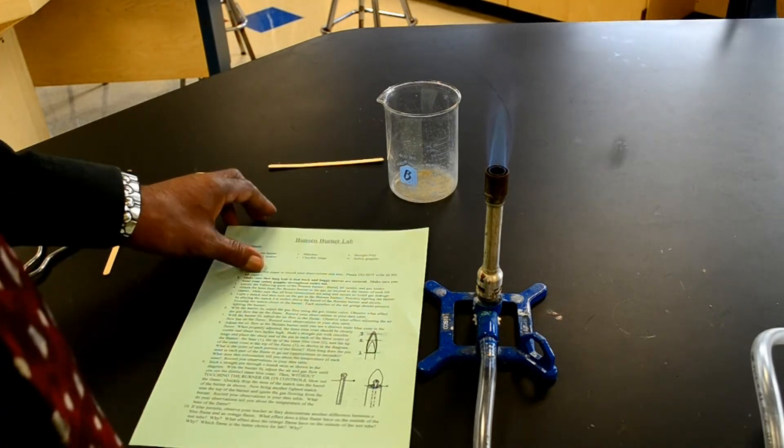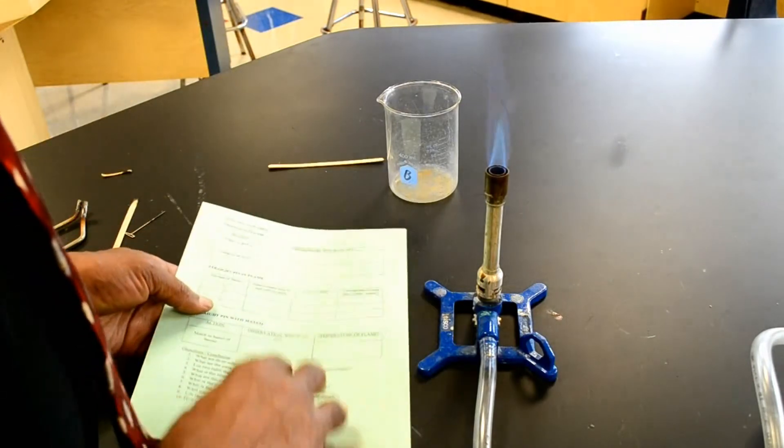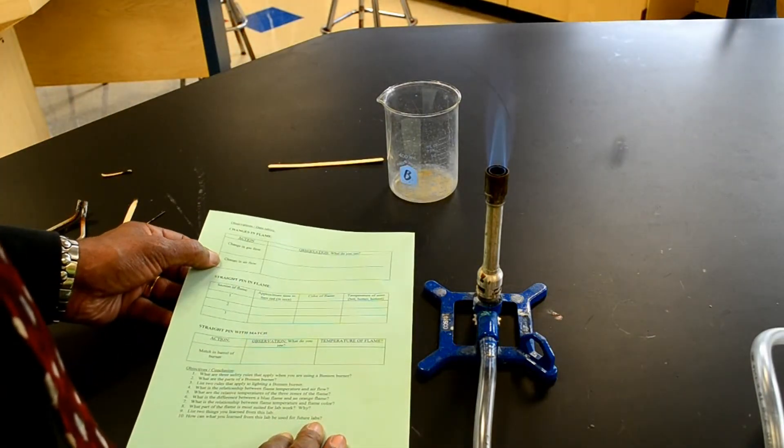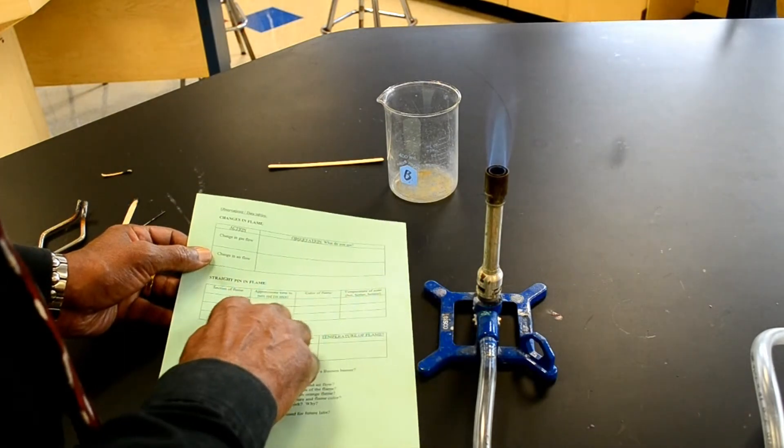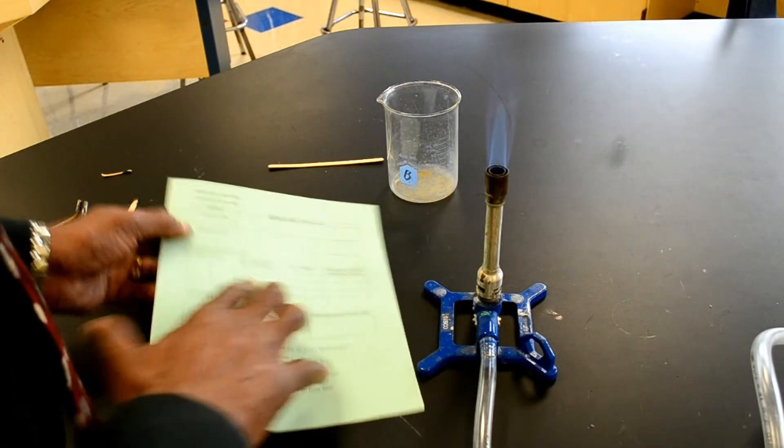Then it says record your observations on the data table. The data table. Here.